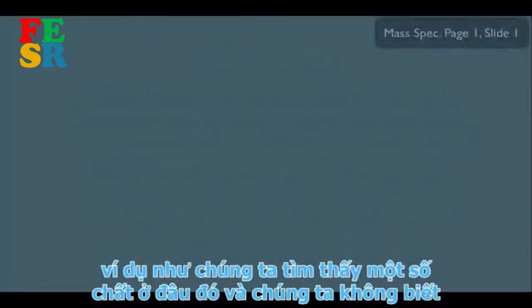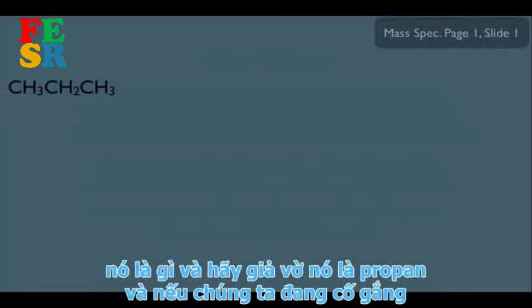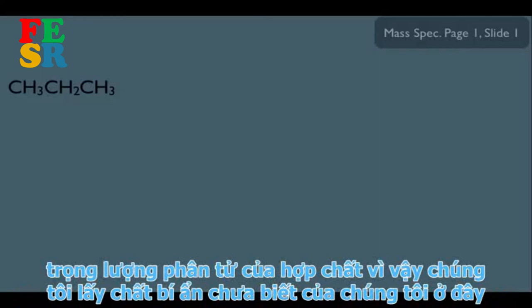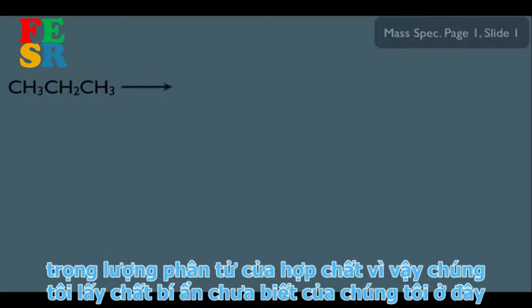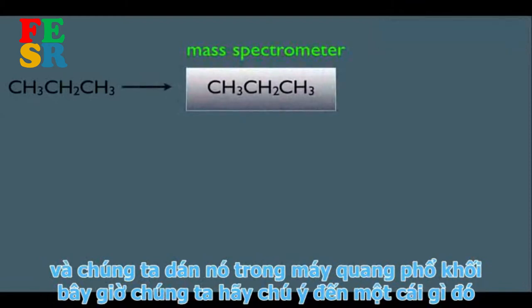Let's say we find some unknown substance and it happens to be propane. If we're trying to figure out what it is, a good place to start is the molecular weight. So we take our unknown mystery substance and stick it in the mass spectrometer.